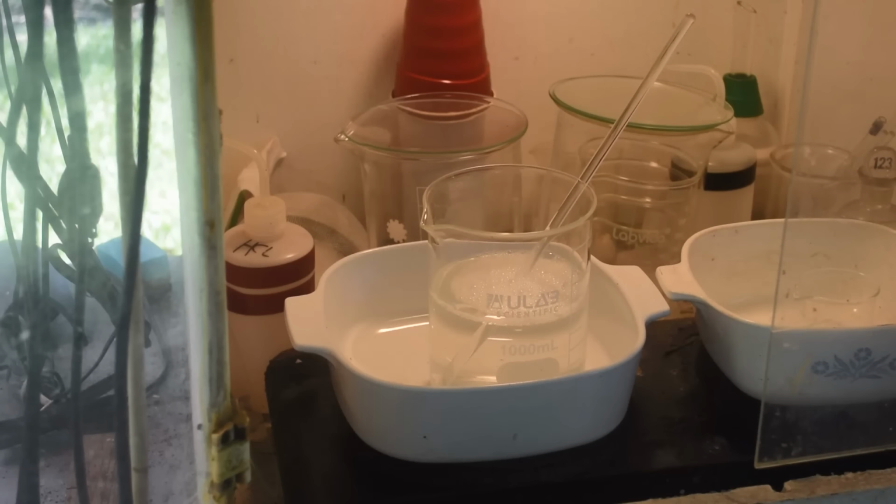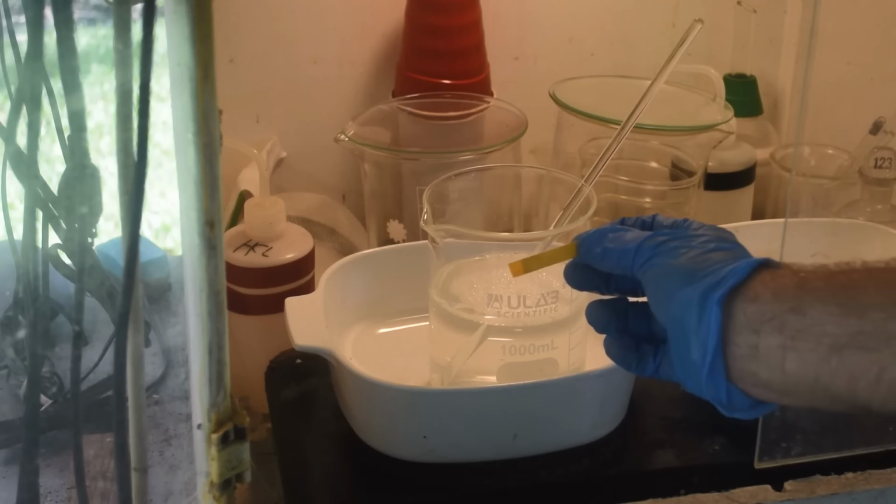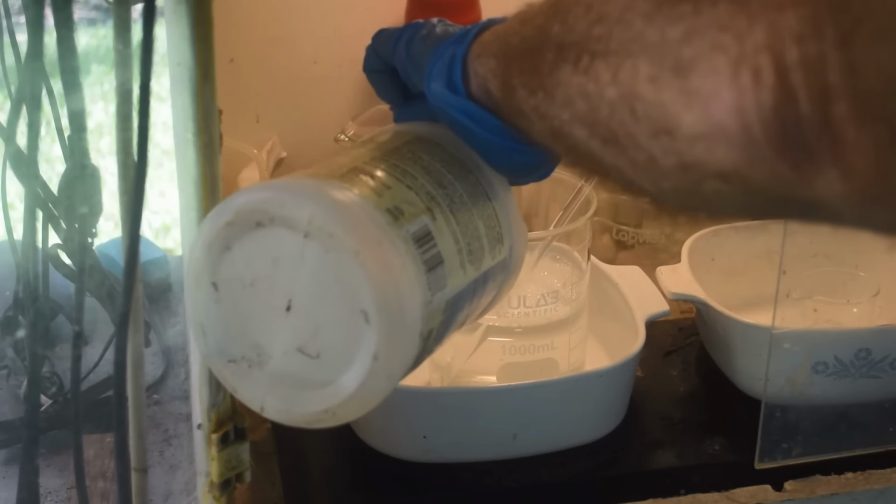Now, somewhere I've got more litmus paper, but I gotta be careful not to waste it here. Oh, we're right about neutral. Right about neutral. Okay, so we want to go a little bit basic. I'm thinking a little more ammonia will probably do it.